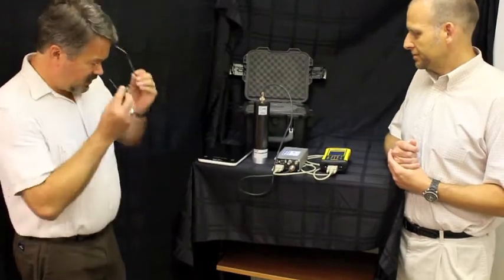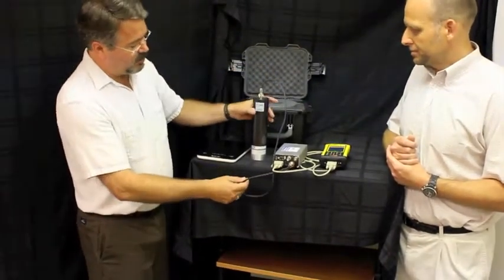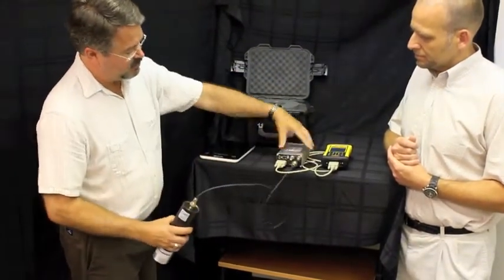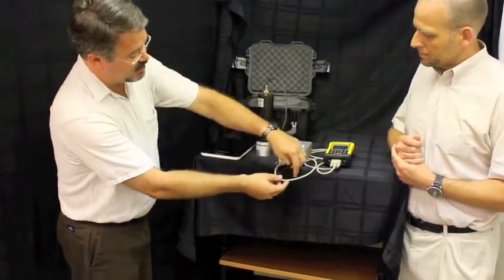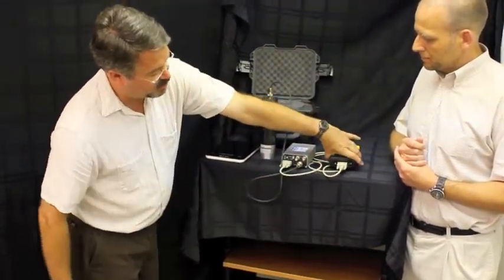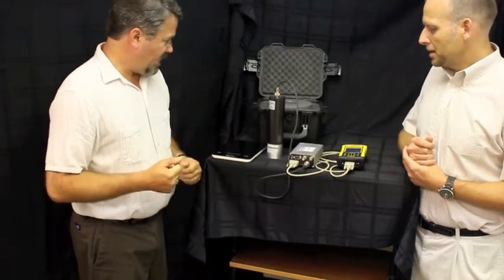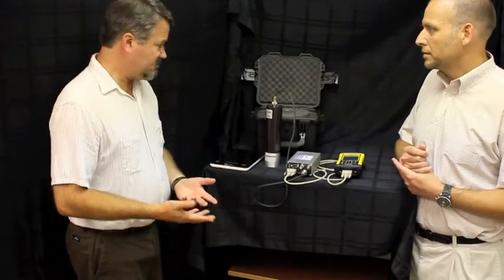The first step of connecting, of course, would be the detector to the multi-channel analyzer, and from the multi-channel analyzer be able to communicate with the mobile device. Those are really the only connections that are necessary for you to get started, and typical field work would work something like this.